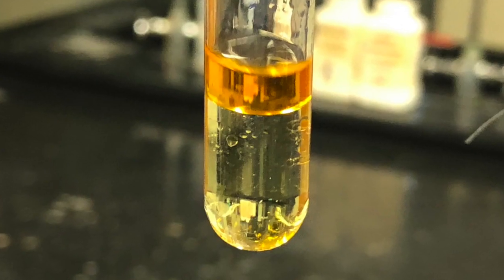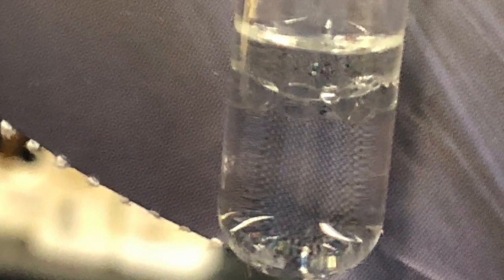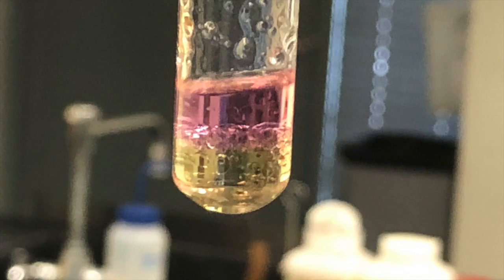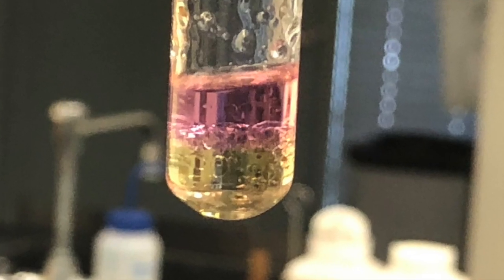First we will examine the colors of each of the elements. This is the color of bromine — you can check the upper layer to see the color. Then the color of chlorine — you can see the upper layer with hexane has the element in it. And then the upper layer for iodine shows a light pink color.